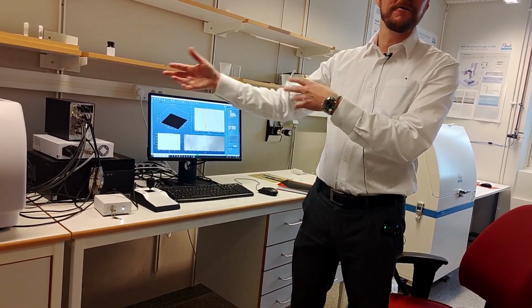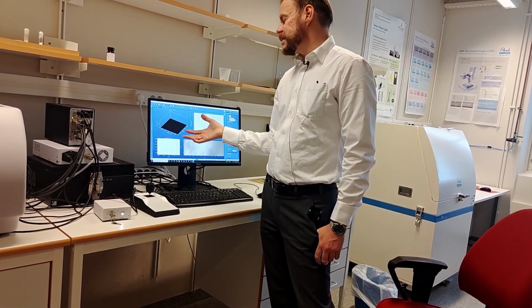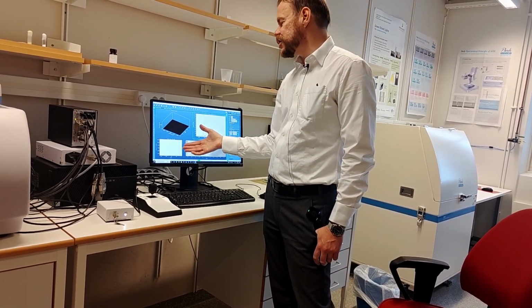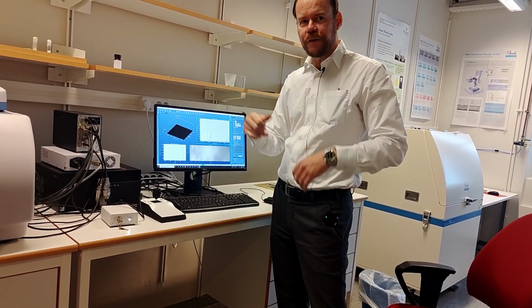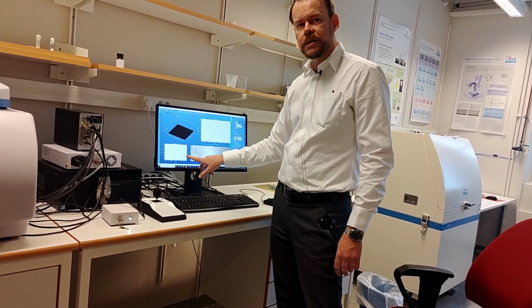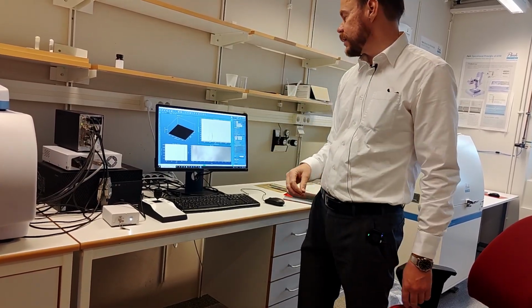So sometimes we are outside the grain and sometimes on the grain. But I mean, it's the same thing. If this is a change in concentration in the sample and you don't have those geometrical surface effects, then you can see the change in concentration here as a function of distance, right?